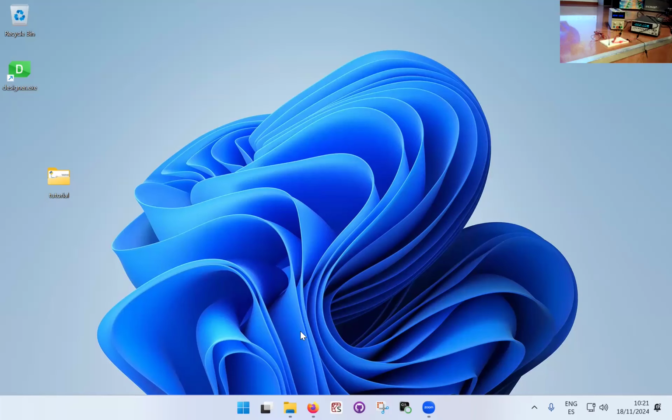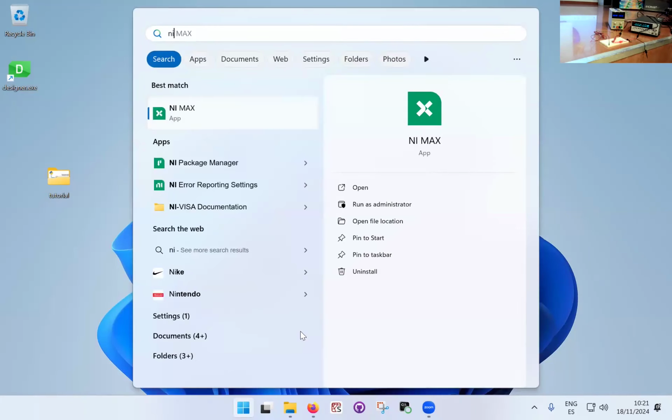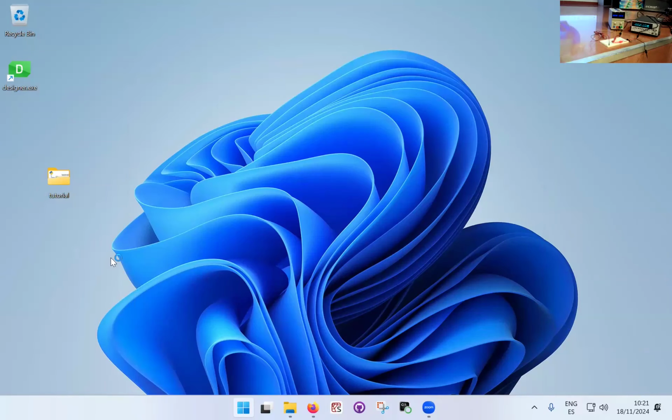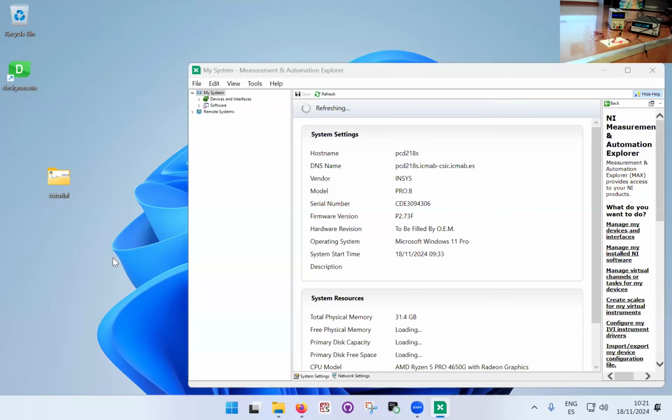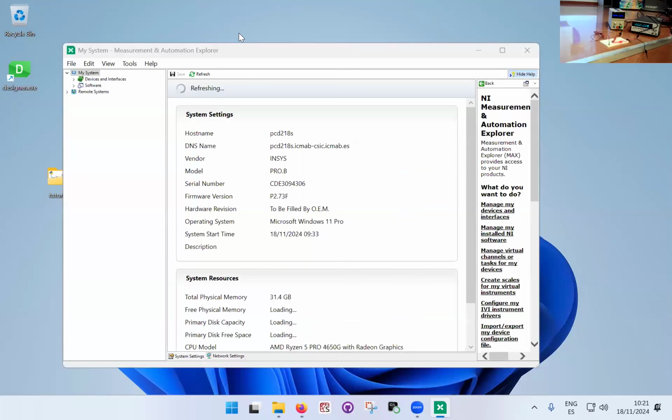Because we installed this National Instruments Visa protocol, actually this NI Visa comes with a utility which is called NI Max, which, since it's already installed, you might as well use it. So when you click the NI Max software, it will come up with this little window, and this window will actually list all the equipment that is connected and available for Windows to talk to.